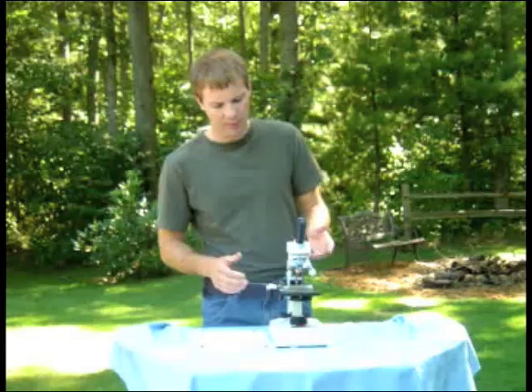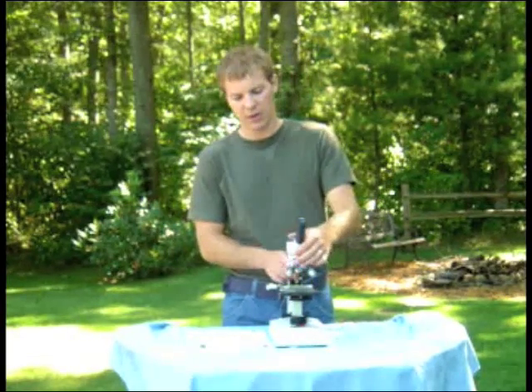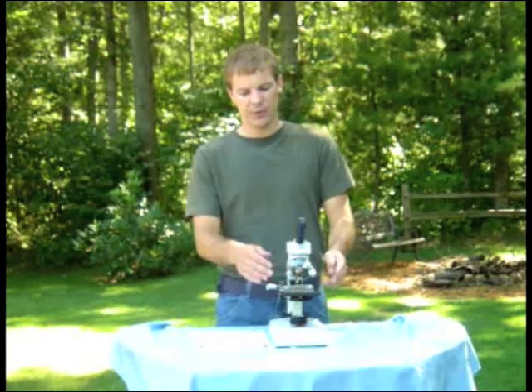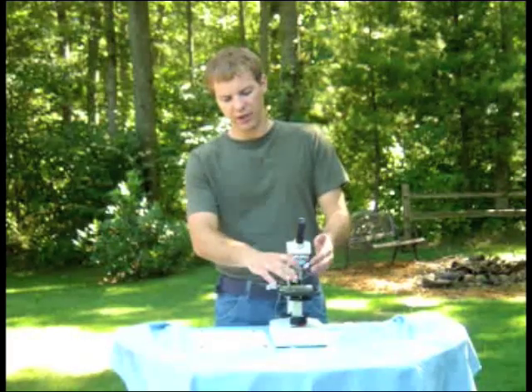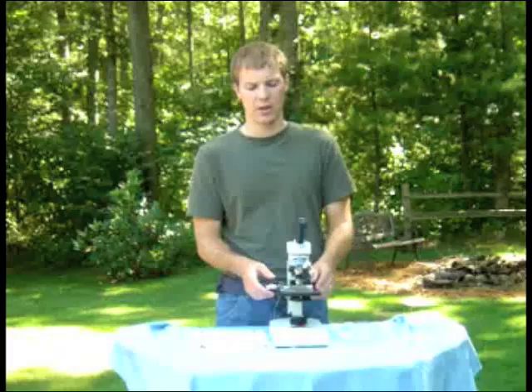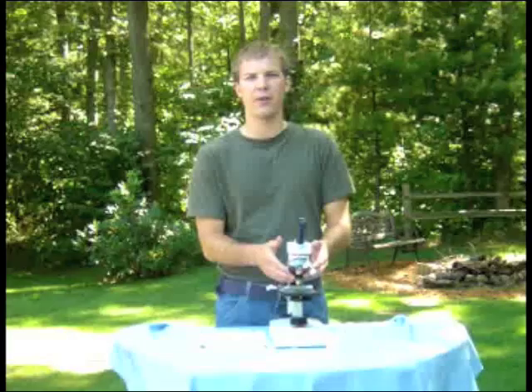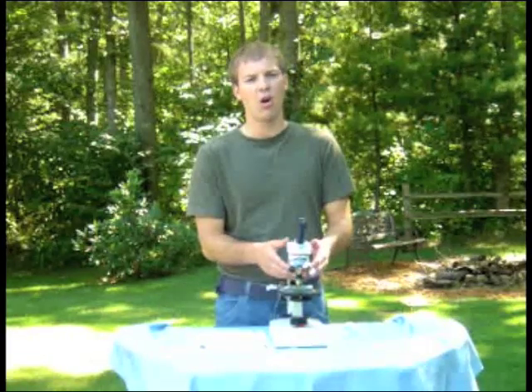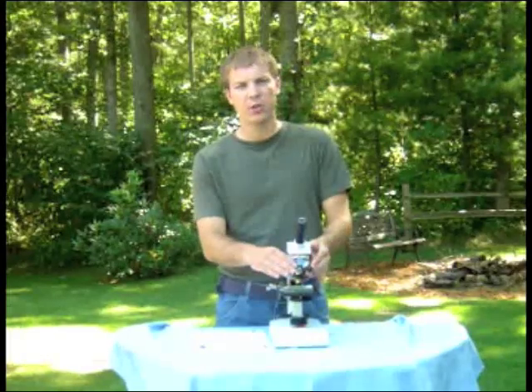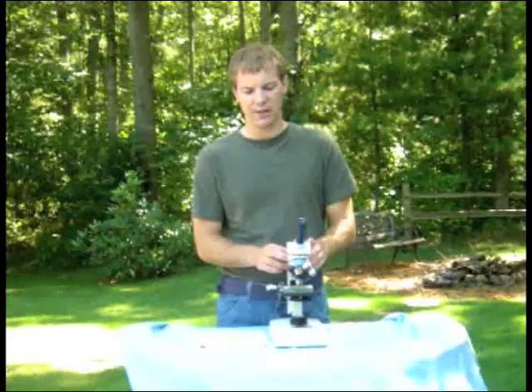Another very common mistake that causes frustration is that students put their slide on the stage but then try to start at medium or high power. That's very difficult because it's tough to focus at high magnification. So always make sure you start at low power and work your way up to high power — it saves a lot of frustration and time.